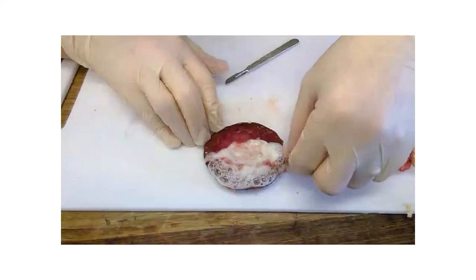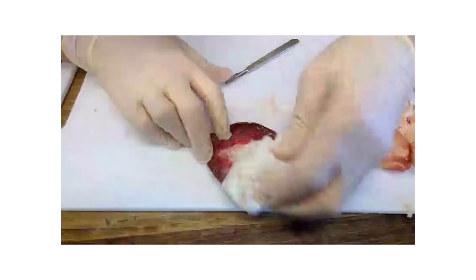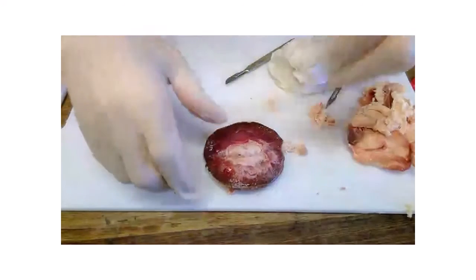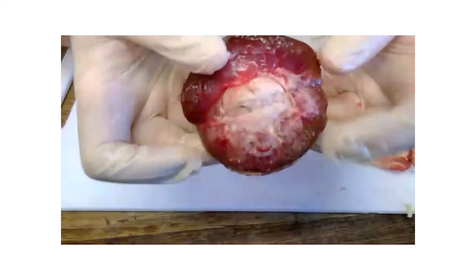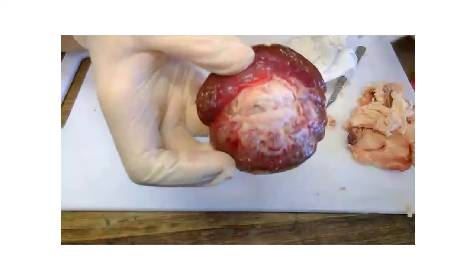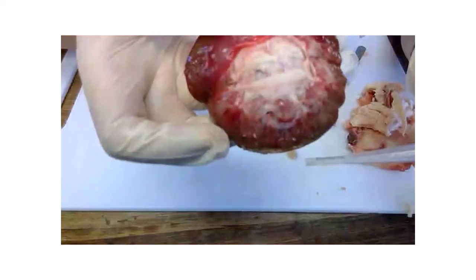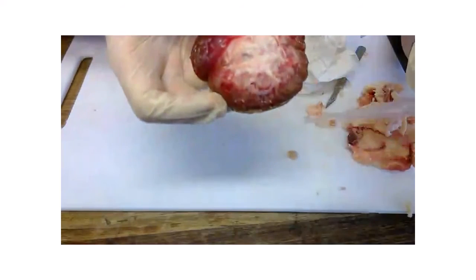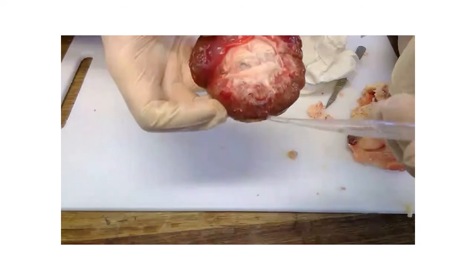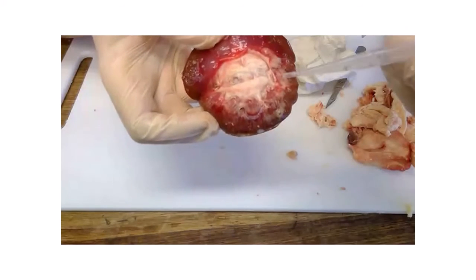Well, because there's catalase enzyme in every body cell, because hydrogen peroxide is very, very toxic. Now, if I pat that away, hopefully what you'll be able to see are little white lines. See the little white lines? Those are the nephrons. Each one of those little lines there is an individual nephron, and there's about 1 million of them in this kidney.